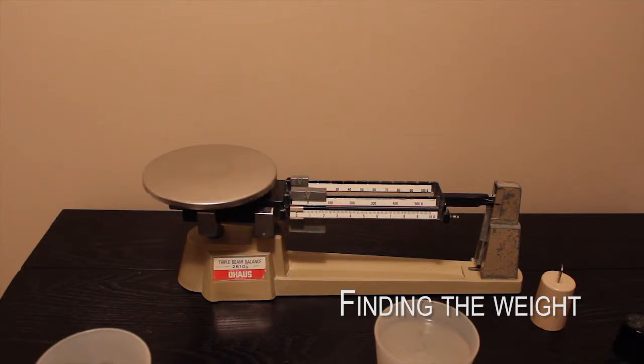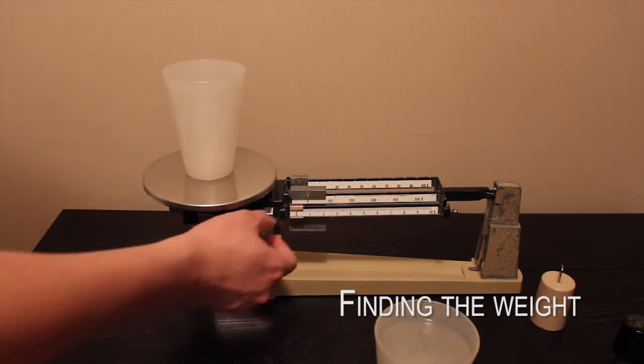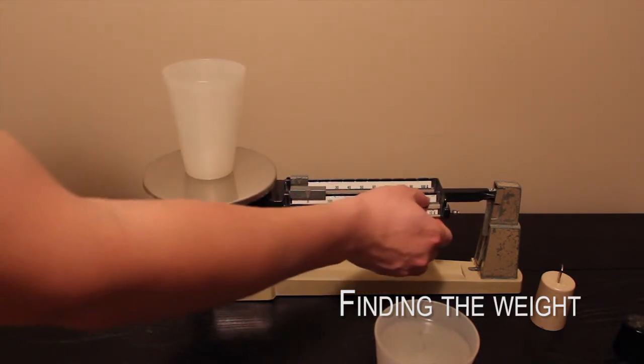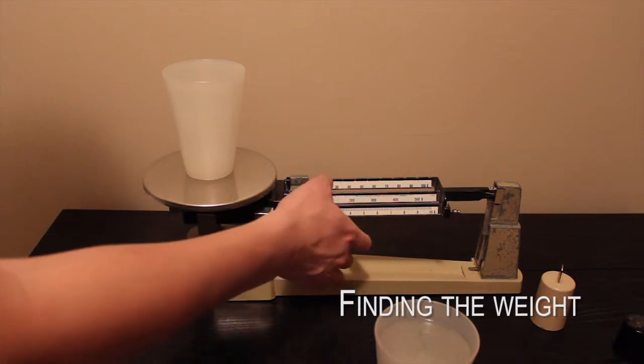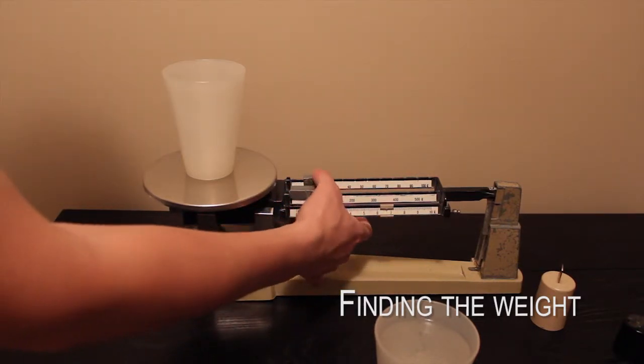Begin by moving the middle horizontal beam's 100 gram weight first, and adjusting it until the estimated weight is achieved by looking at the balance pointer. The balance pointer drops below the middle point, then move the 100 gram to the left graduation.